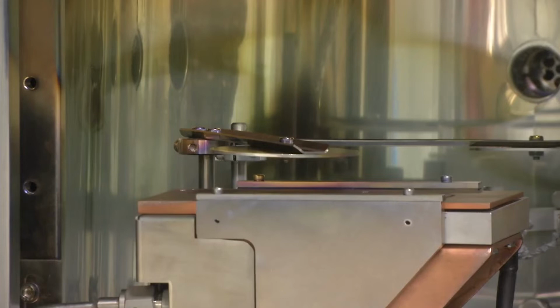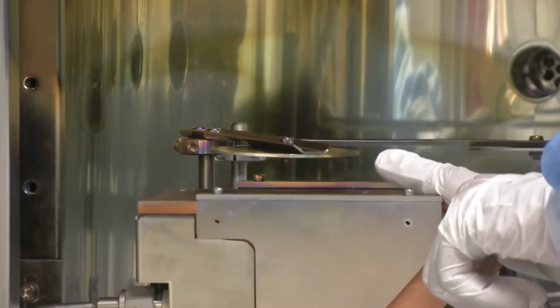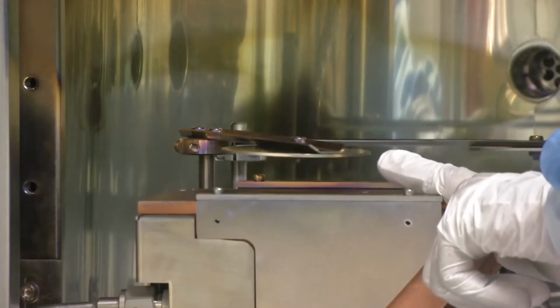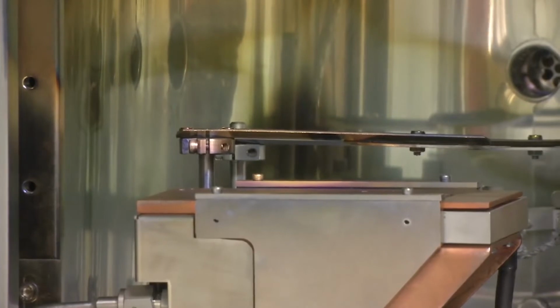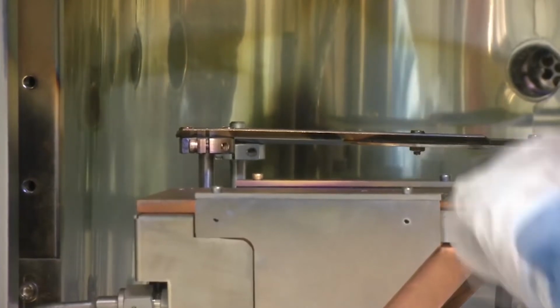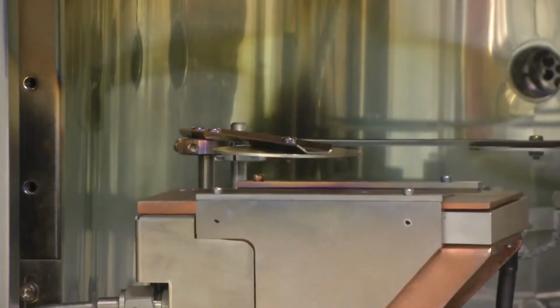So this is the role of the metal shutter. The control for the metal shutter is outside the chamber, and just by pressing a knob we can open or close the metal shutter. As we can see, my colleague has now opened the metal shutter by pressing a knob. In a similar way, we can press the knob again to close the metal shutter. This can be done while the process is going on and the chamber is under vacuum.